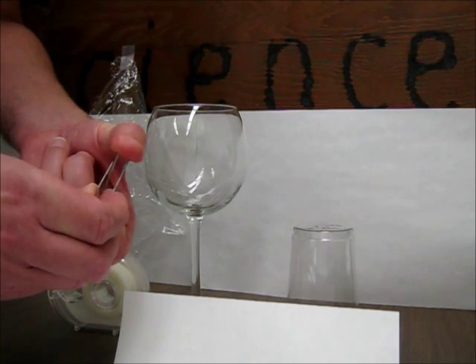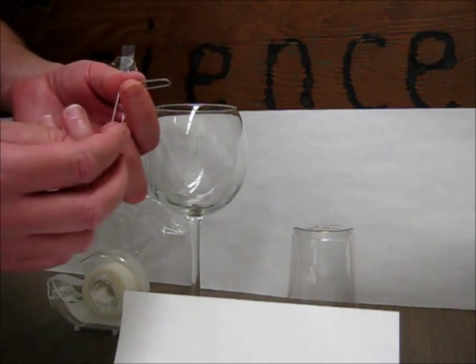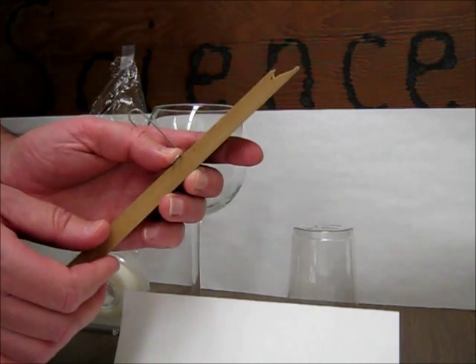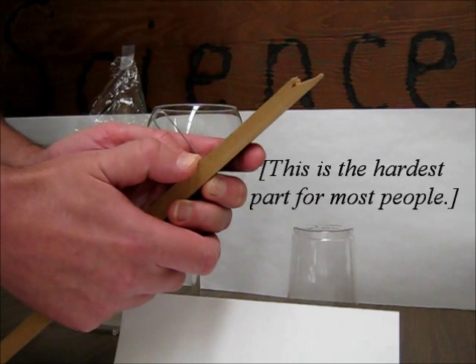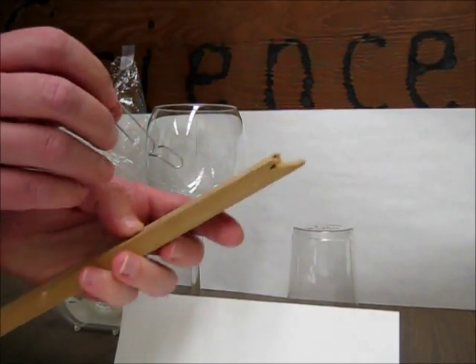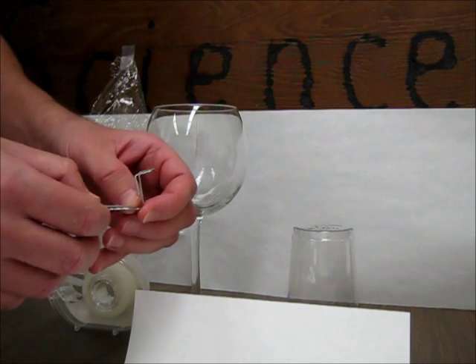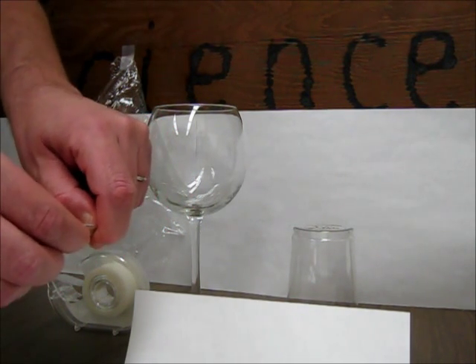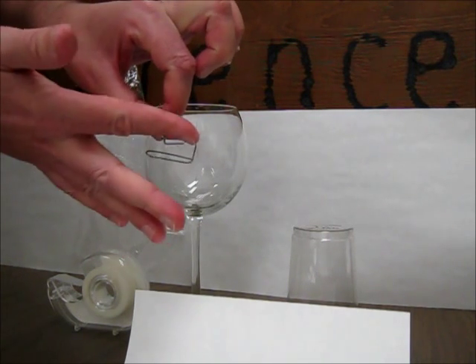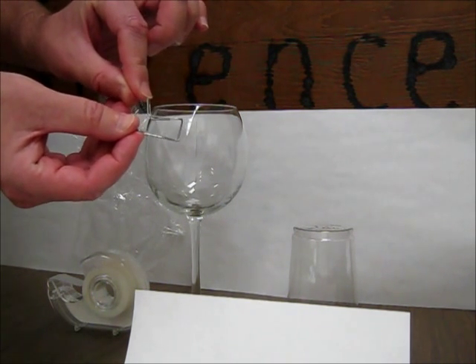I open it up for my first bend. Okay, 90 degree angle. Doesn't have to be exactly 90 degrees. Next, I usually go along the side of the desk, but today I brought a piece of wood so I can show you on the camera. I'm going to bend it. Again, if I used tools like needle nose pliers, this would be much easier to get straight, but I want to bend that. So now it's more or less like this. Okay. Finally, I make another bend in the long section. And the point now is that this long section and most of the shorter section are parallel to each other. This is how it hangs. The nub that sticks out on top is what I connect electrically to.